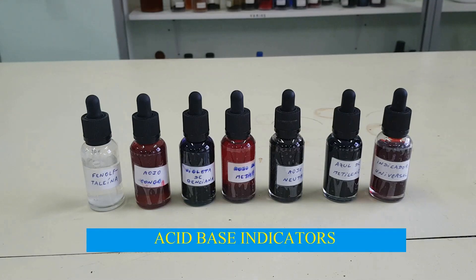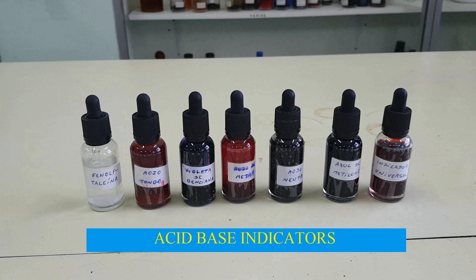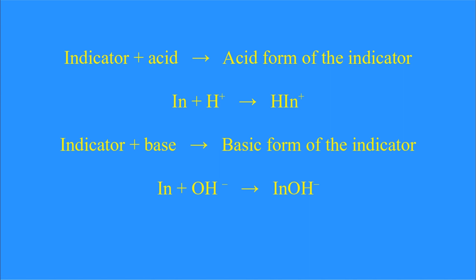These are some acid-base indicators. They are substances that change their color depending on the acidity of the medium. They are used in chemistry to do an experiment called acid-base titration. When an indicator reacts with an acid, it forms HIN positive — the acid form of the indicator.